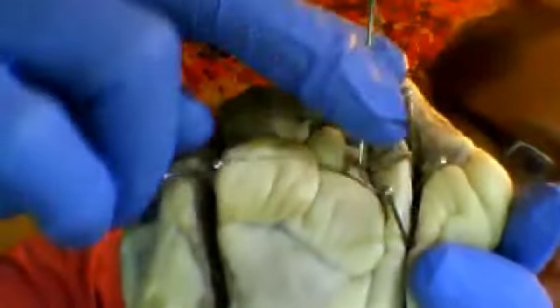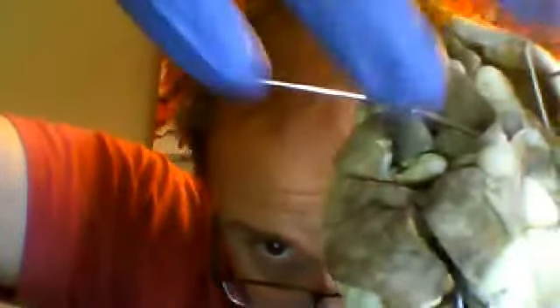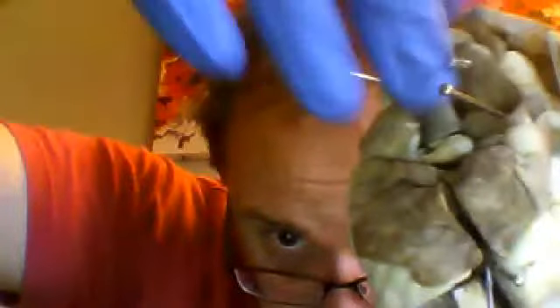Let's move on to superior and inferior vena cava. The superior and inferior vena cava are both venous structures that actually carry blood into the heart. So you have the inferior vena cava, which is located here, and the superior vena cava, which is located in this area. I'm sorry, let me move my hand. Right there. See how I'm pointing into that opening there?